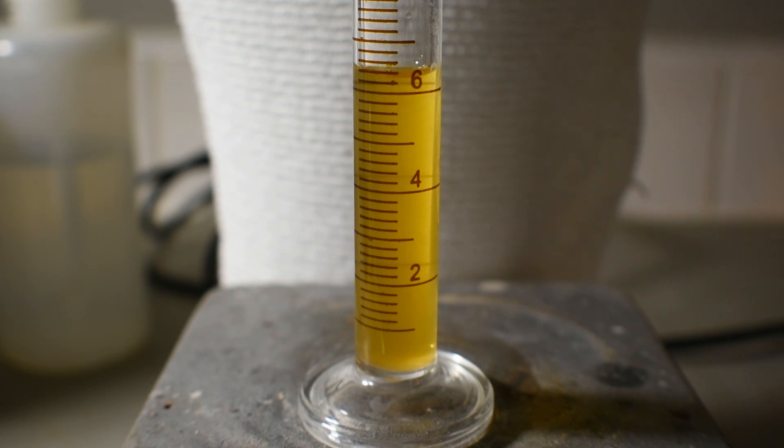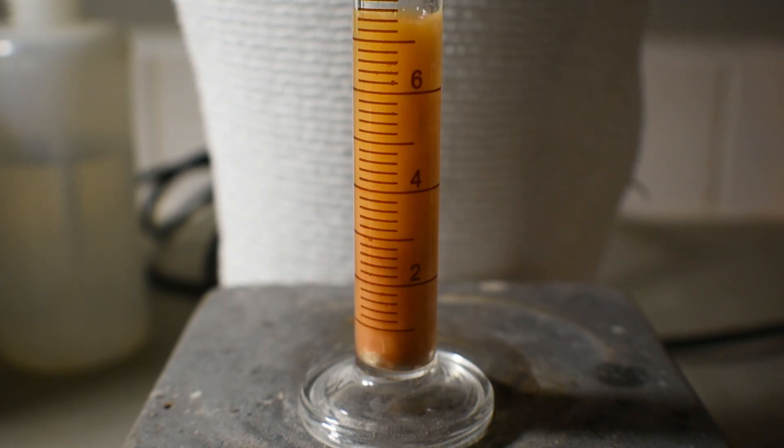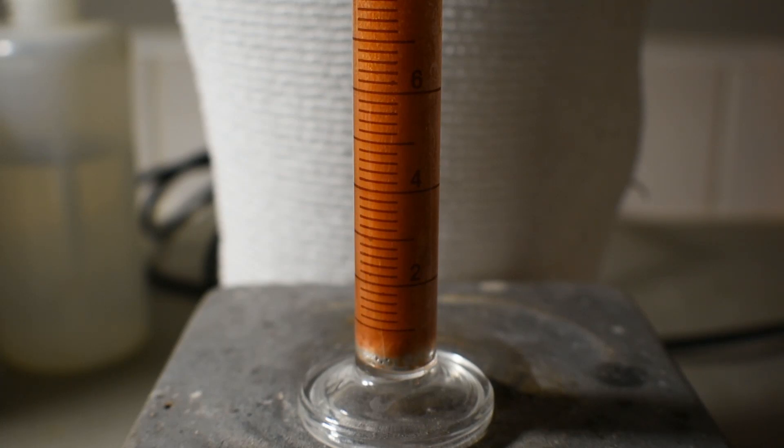Immediately upon addition, we can see a dark red color forming in the mixture, along with a large amount of hydrogen gas being evolved. This red color is the color of the nickel-1 complex, the formula of which looks like this.